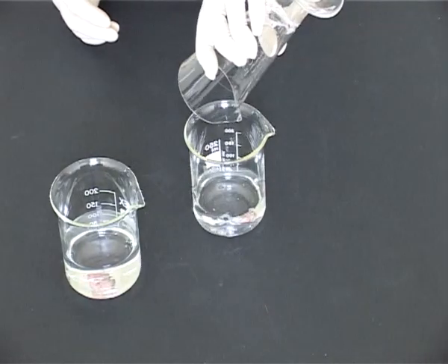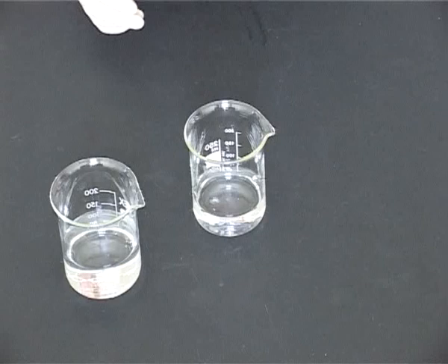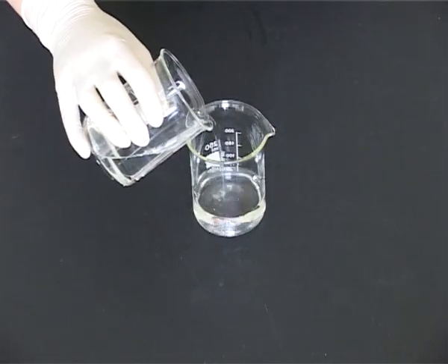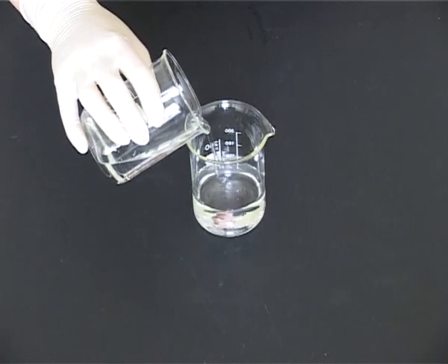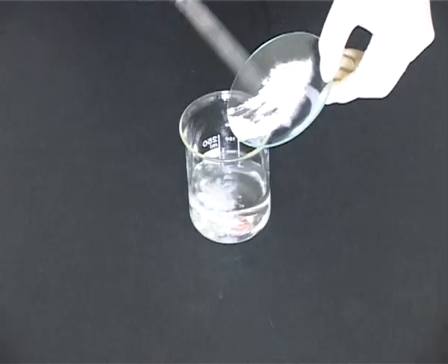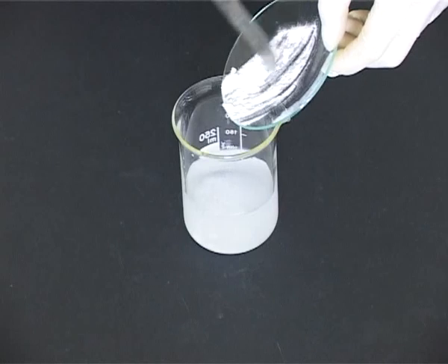Calculate the quantity of vehicle required for dissolution and add approximately that amount. Note, in this case, all the double-strength chloroform water is required and also some extra potable water in order to dissolve the solid. Remember the basic principle of adding solute to solvent.